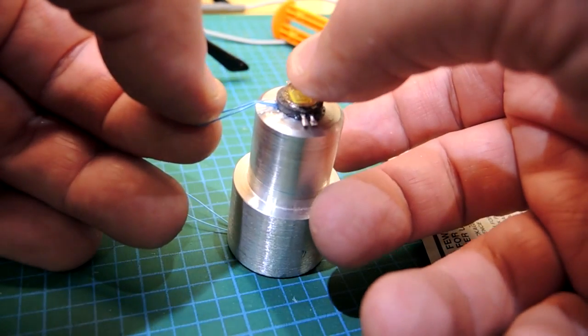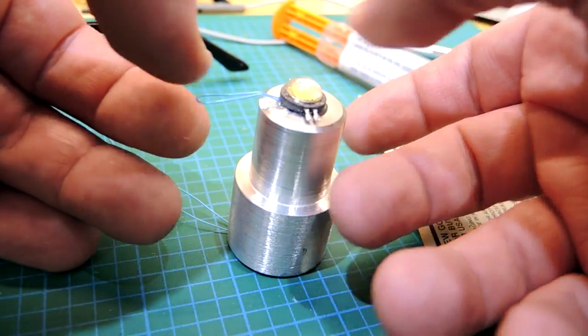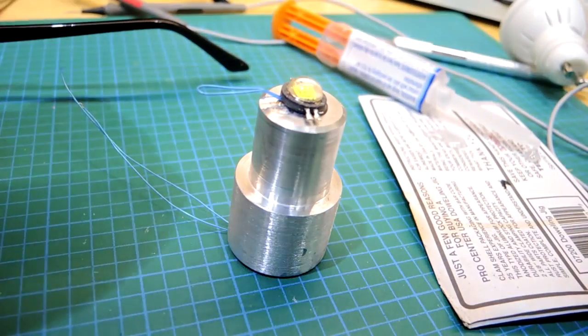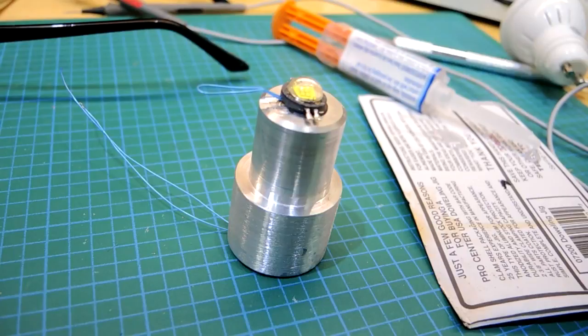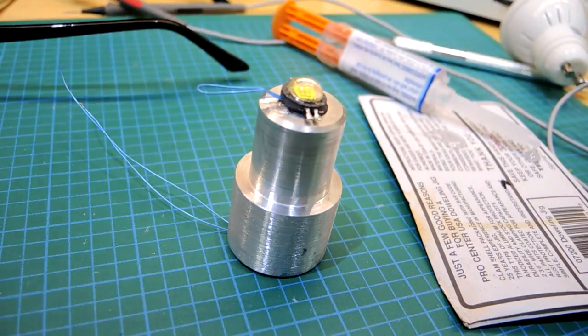The next thing I needed though was to create a diffuser. When I put this in without the diffuser, you can see essentially the LEDs were too hot, too bright. They're illuminating the center part really well but creating really deep shadows.